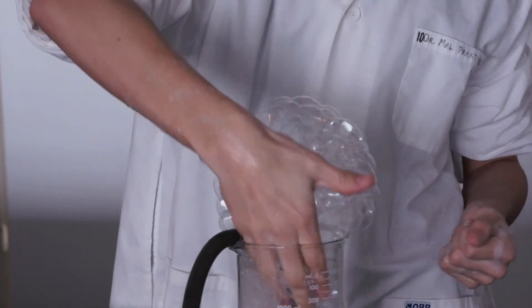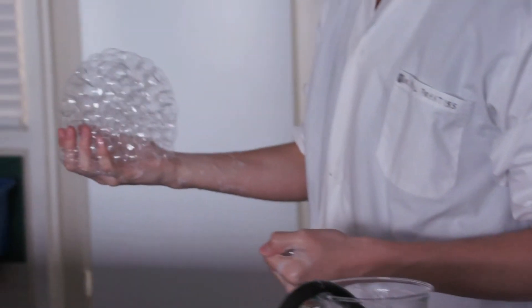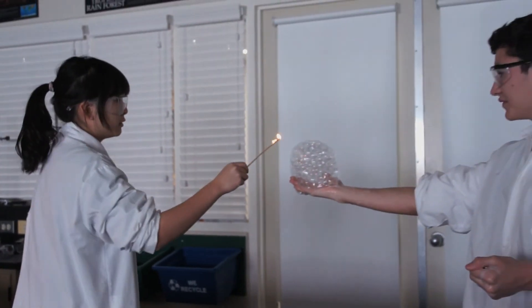So right now, what I'm going to do is I'm going to scoop the bubbles off. Helen's going to turn on the ignition. Okay, so ready? Yes. One, two, three.